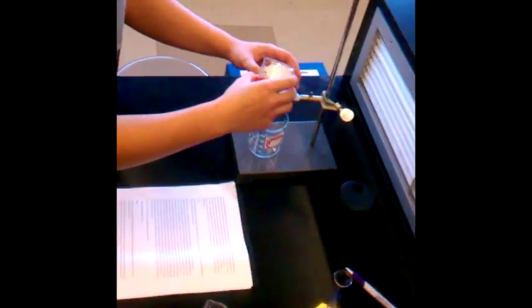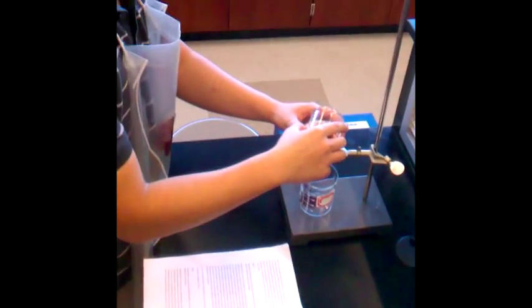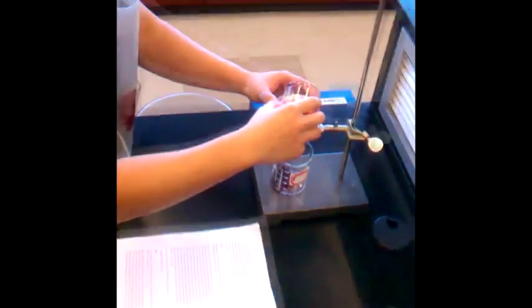Once you have prepared the solution, pour it through the filter. The purpose of adding sodium chloride to the iron FEN solution is to remove as much insoluble impurities as possible when filtering it into a 150 mL beaker.